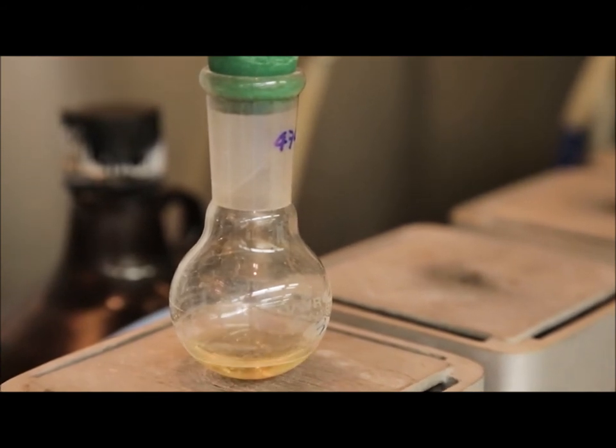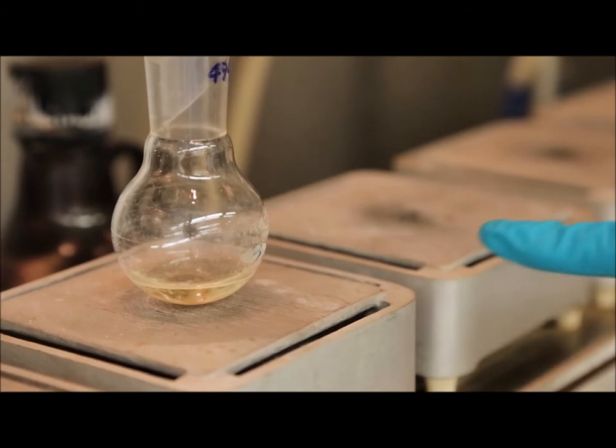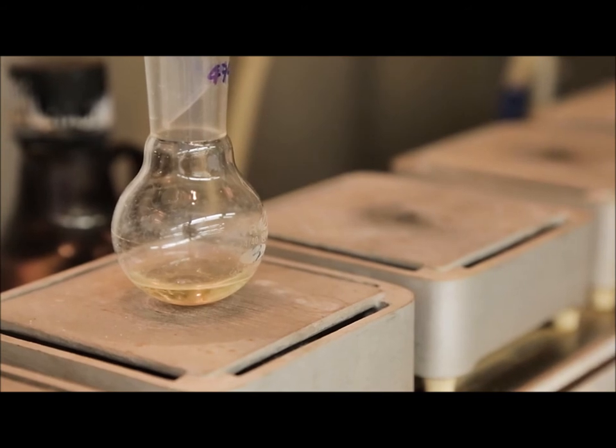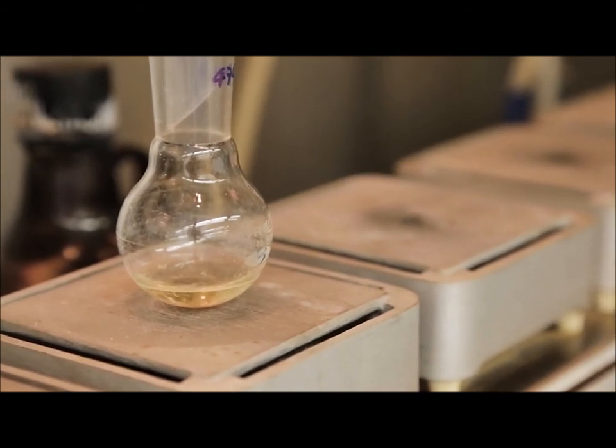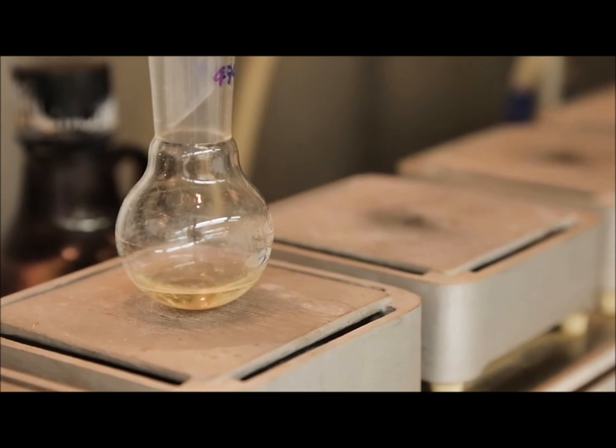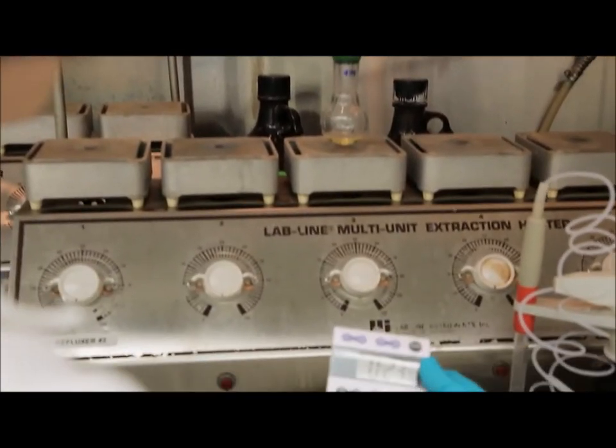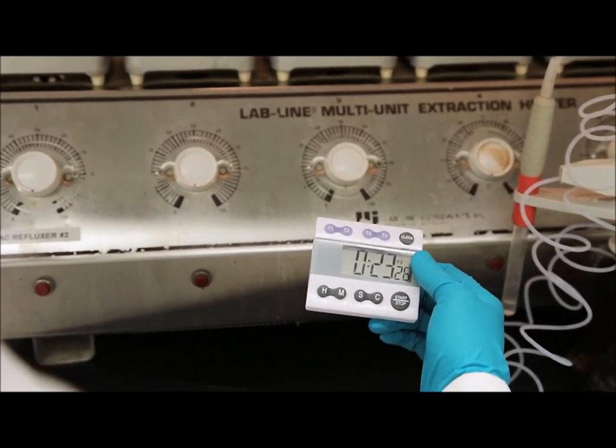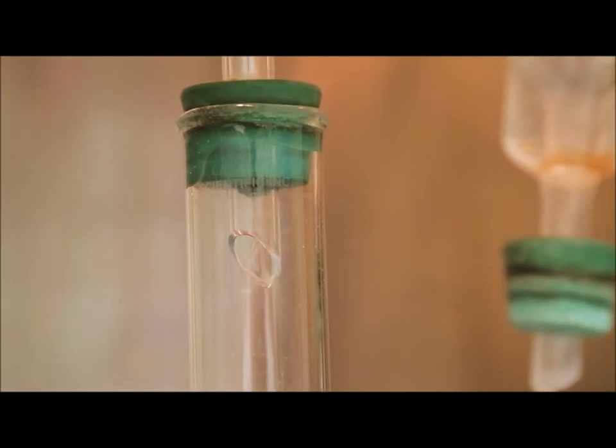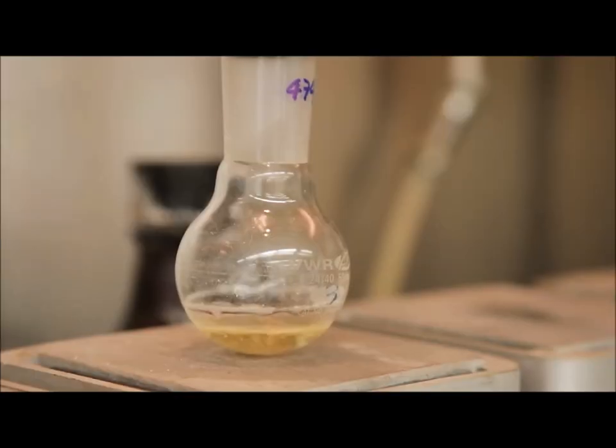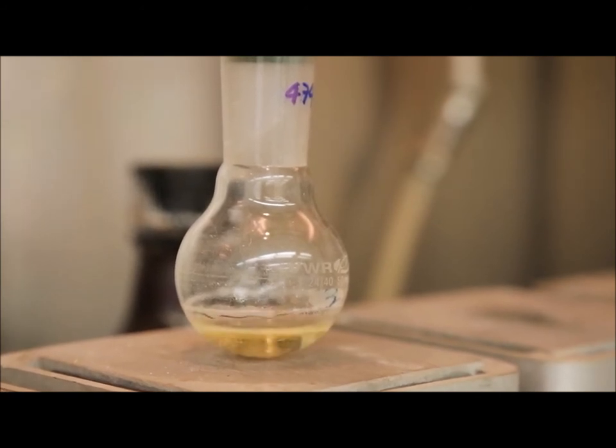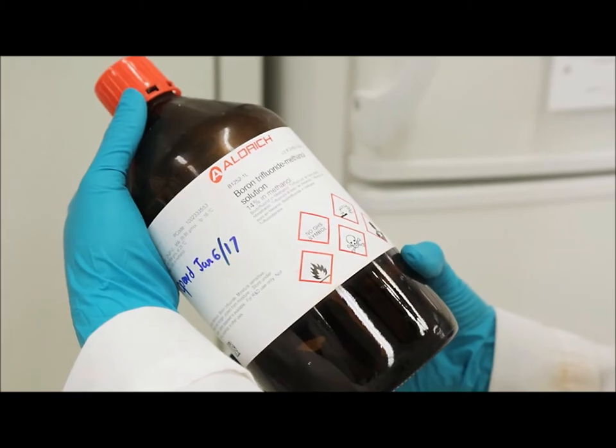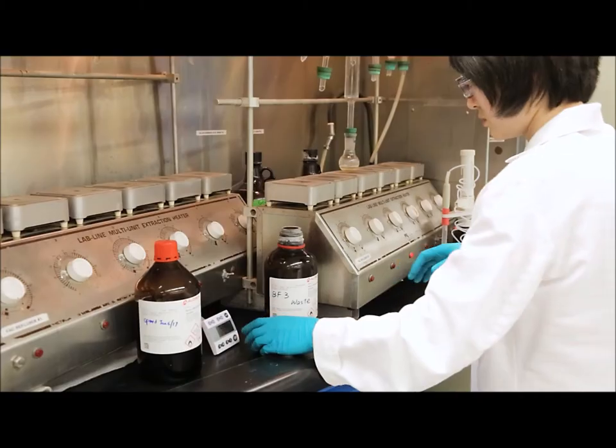It is also important during the refluxing stage that you see the fat globules go into solution while boiling.